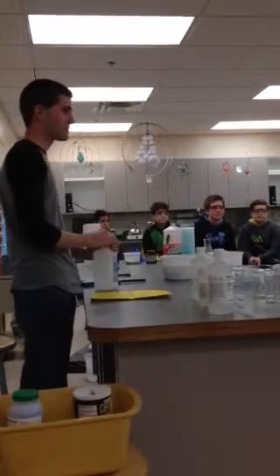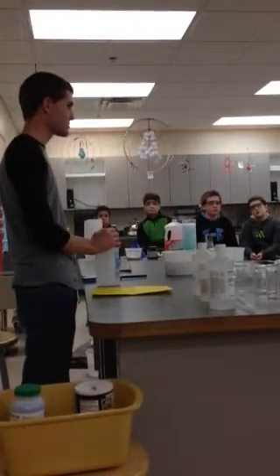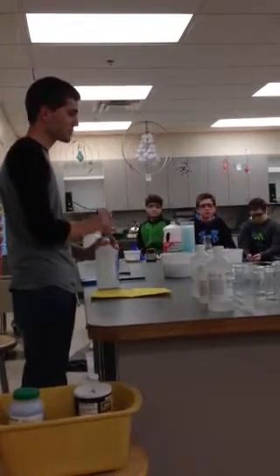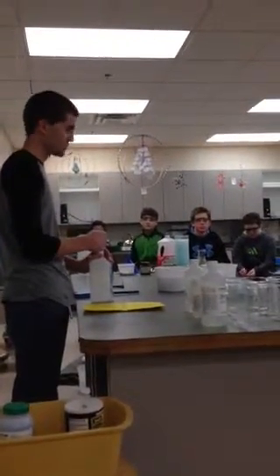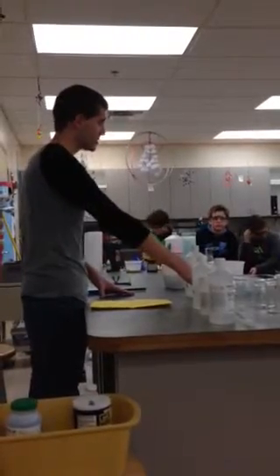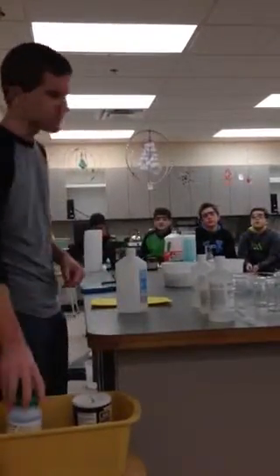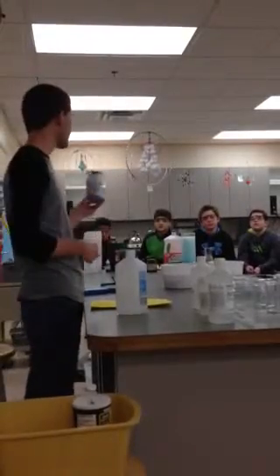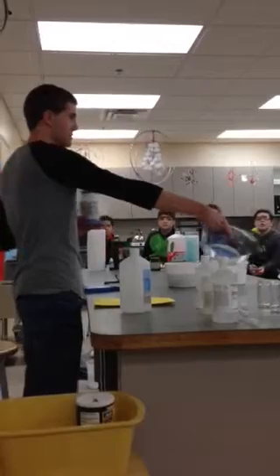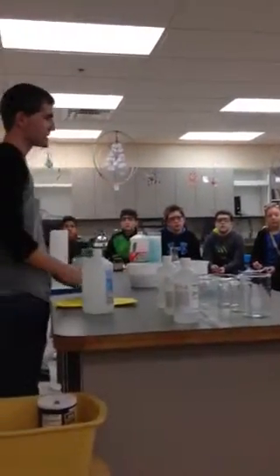There's heat, there's energy being released. If there's energy being released, is that a chemical or a physical change? Chemical. Chemical change. So in fact, this one is a chemical change. Now, the question is, can anyone figure out why adding copper sulfate, this blue crystal, which by the way does not burn, you're not seeing it burn, it's still there, I haven't added any extra, makes it green.